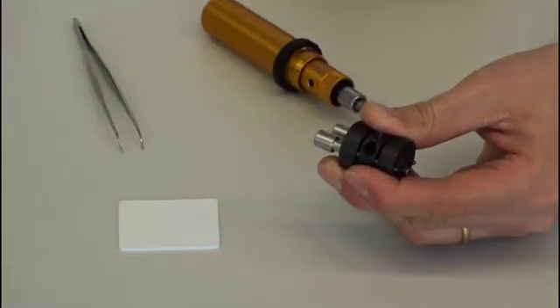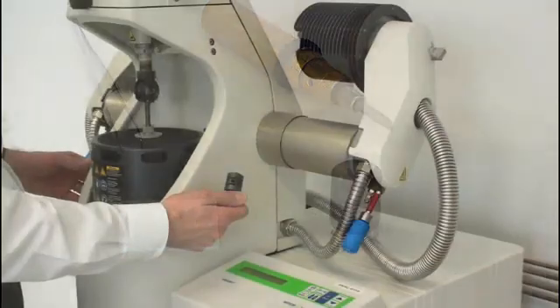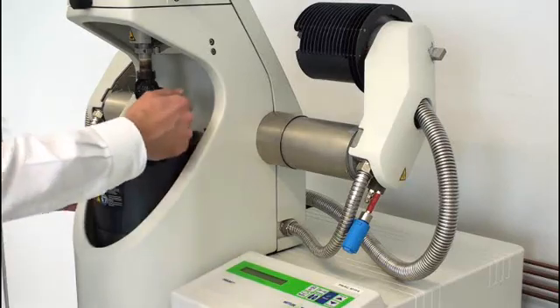Imagine how difficult this would be if you could not take out the clamps of the furnace, if you would have to mount these samples right in the furnace assembly. Once the sample is clamped, we insert it into the clamp assembly.